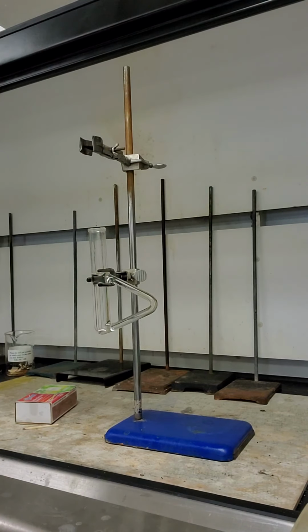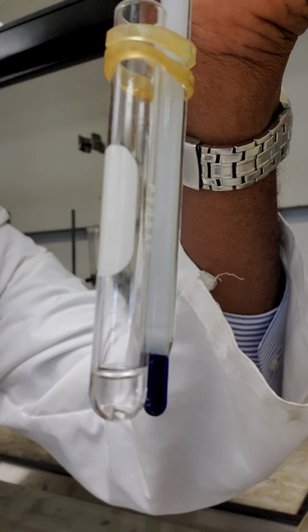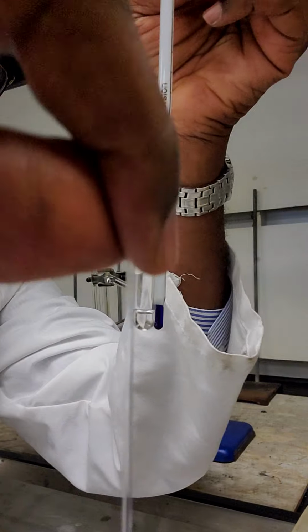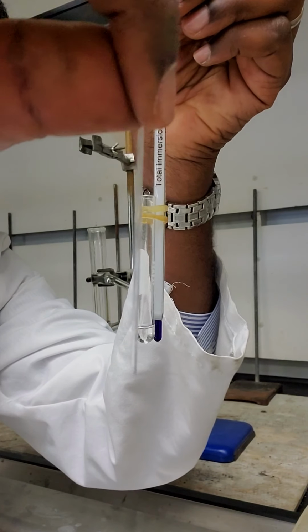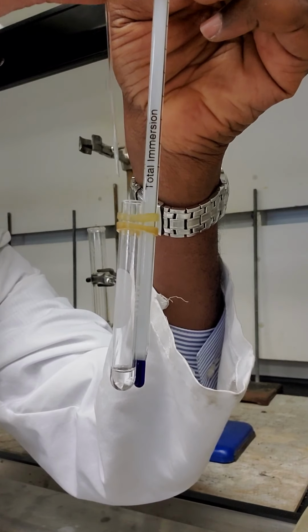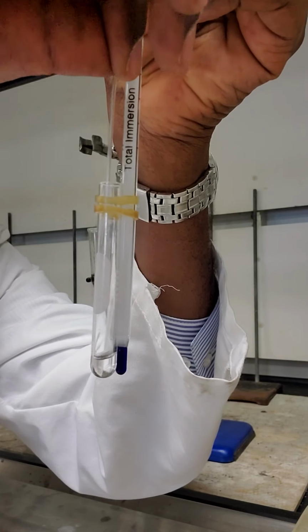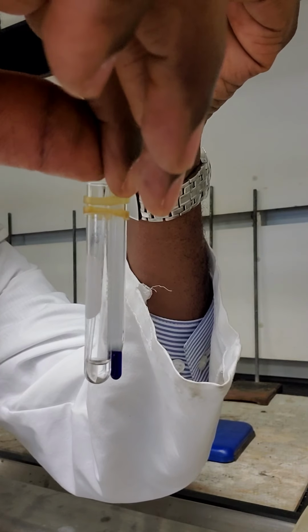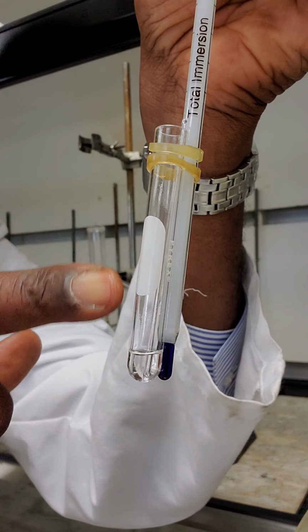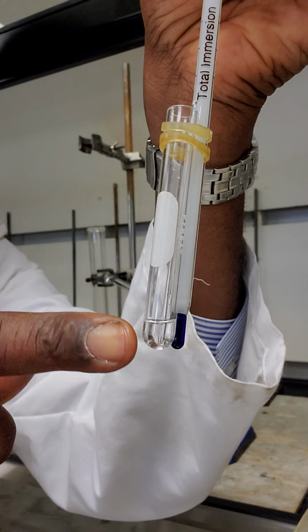And so I'm going to bring back my tube. Can you see my tube here? Good. Can you see the capillary tube? Look at my test tube containing the liquid. I'm going to place this here. Look at the open end. I'm going to place it inside the liquid in a slanting fashion. Now, the capillary tube with the open broken end downwards is immersed into the liquid.